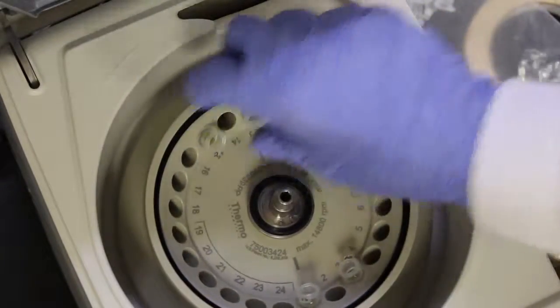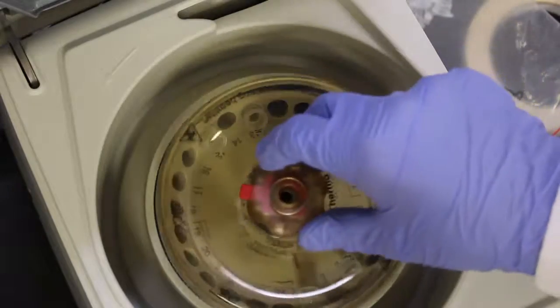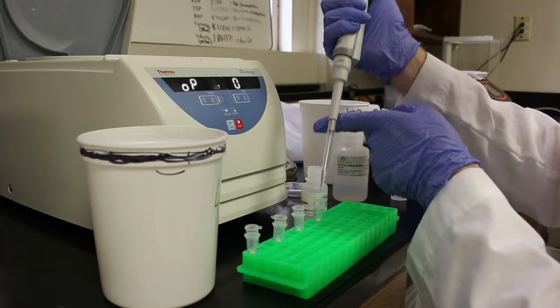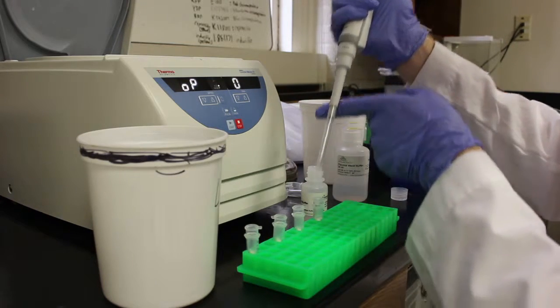Centrifuge the mixture for 30 seconds into a collection tube. Add 200 microliters of endo-wash buffer and centrifuge for 1 minute.